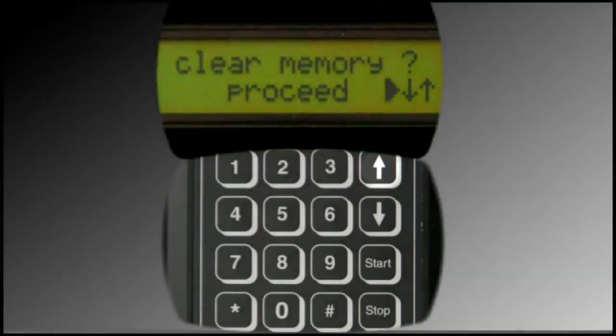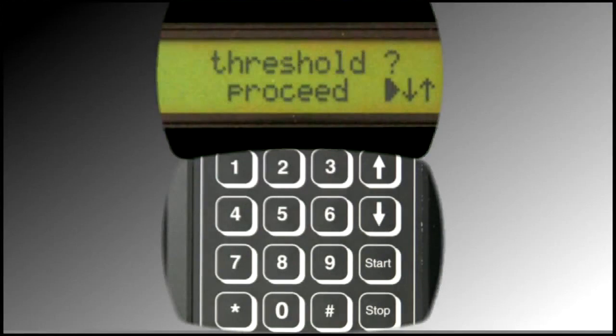Press the up arrow. This is where the threshold pressure setting can be adjusted. The pressure threshold is the range of pressure that must be adhered to once an integrity test begins. There is a lower and upper threshold value programmed in the device. The default value for both is 0.4 psi.